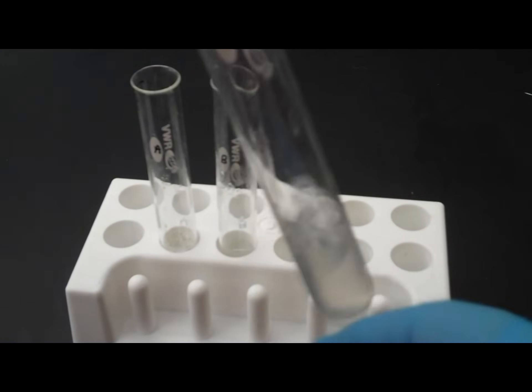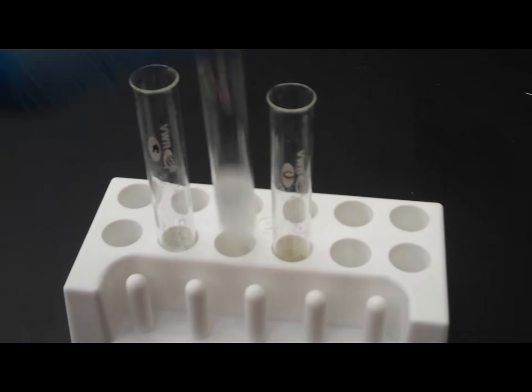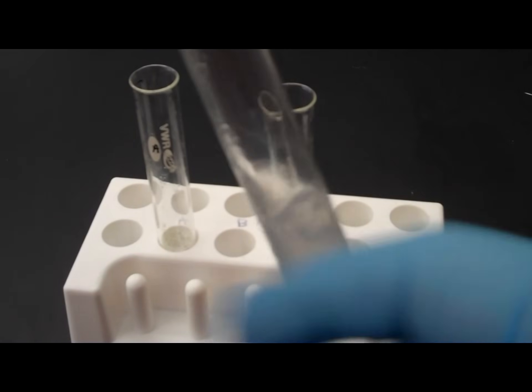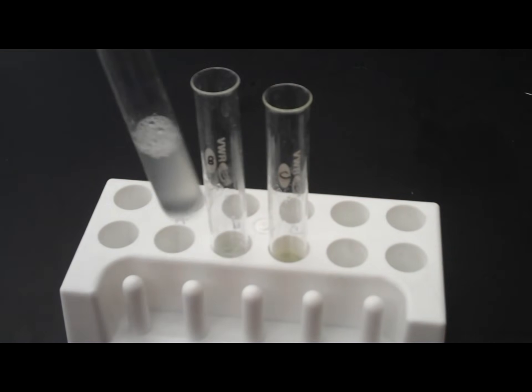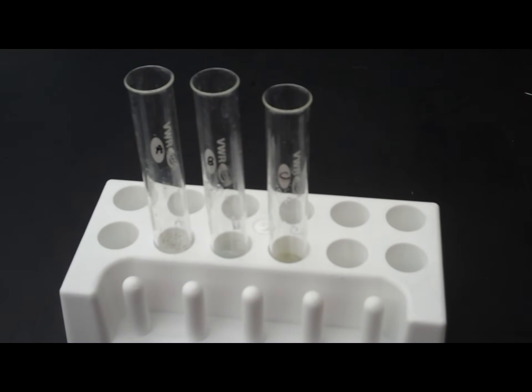I'm going to thump them to mix. Now, we need to let that starch solution and amylase sit together for about 10 minutes or so. At this point, the amylase is breaking down the starch into simple sugar.